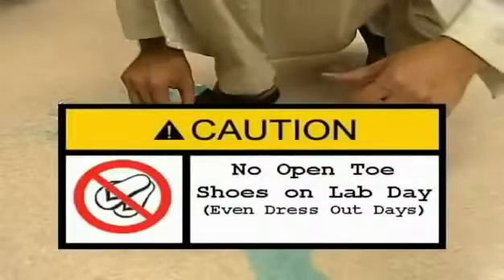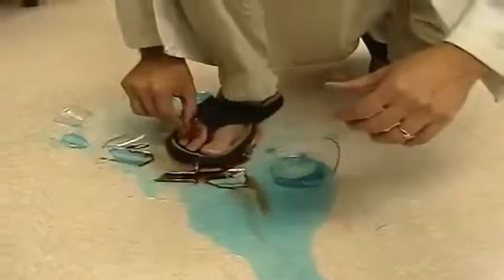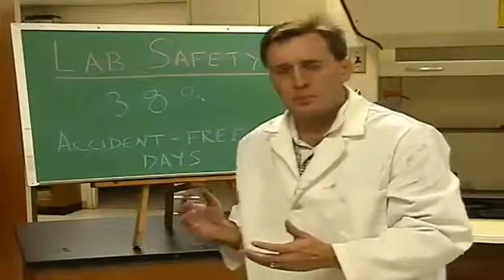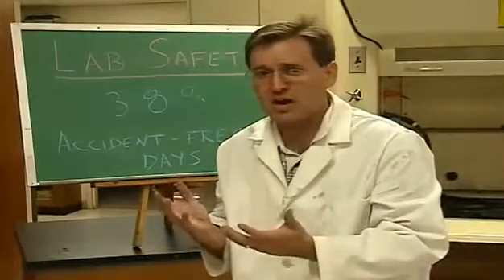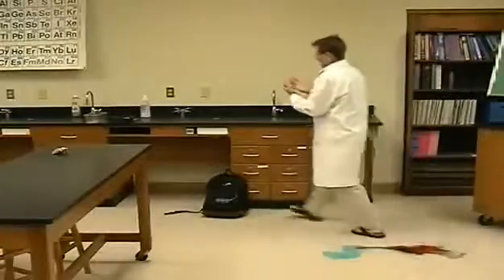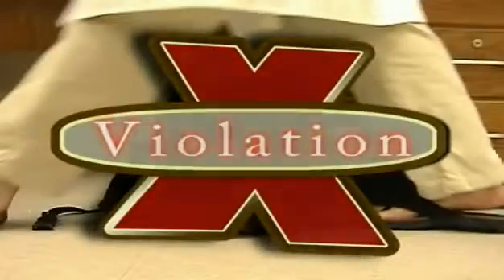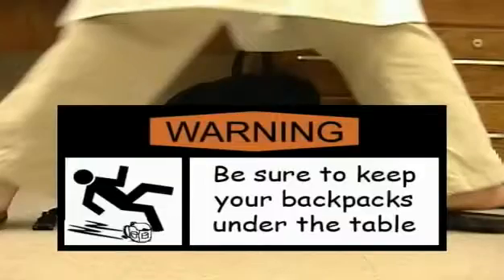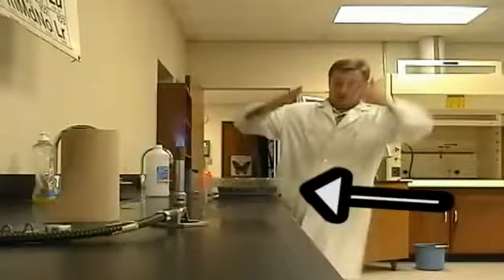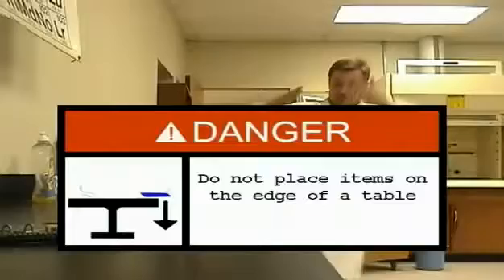Violation! No open-toed shoes on lab day, even dress-out days. That's gonna leave a mark. Practicing lab safety, I'm going to wash my hands at the wash area, and then I'm going to bandage my foot. Violation! Place backpacks under the tables. Violation! Where? There! Do not place items on the edge of a table or lab bench.